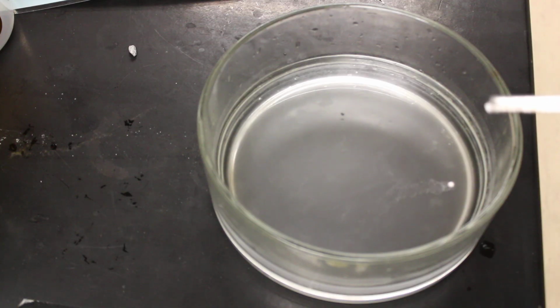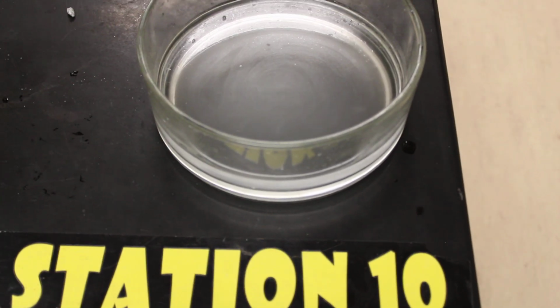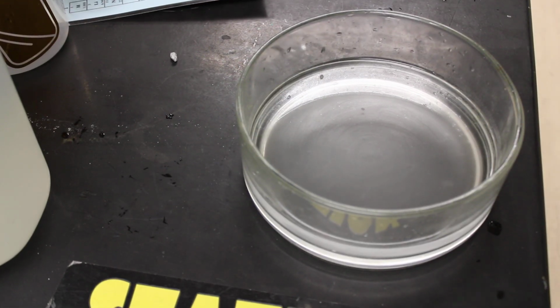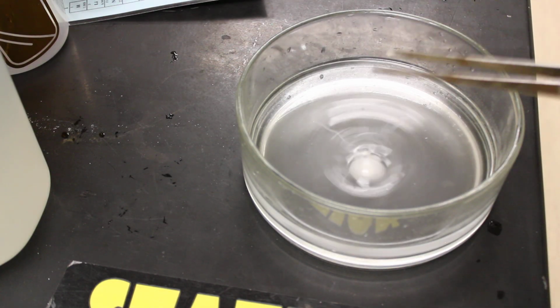Okay, now as he's just finishing up his last little bit there, we're going to take one more step down the periodic table, and that's going to get us to potassium. Now for potassium, I'm going to back us off just a little bit here, just so that we're a little bit further away here. Not too much, but this is potassium, K.